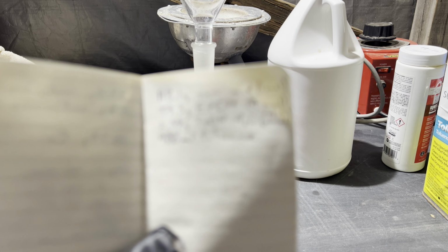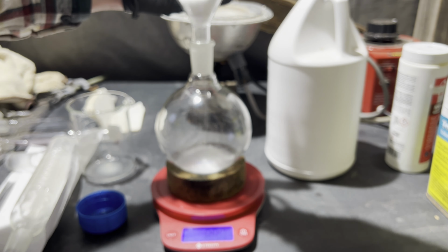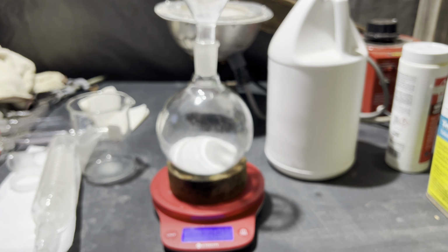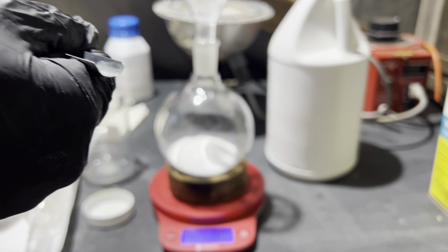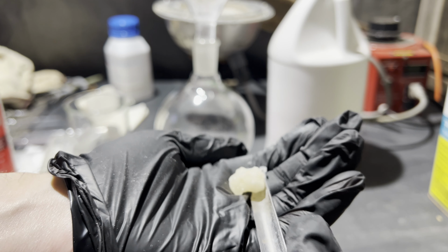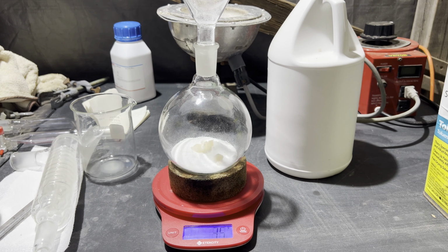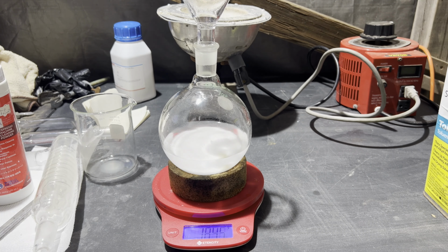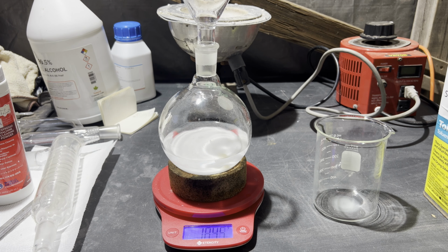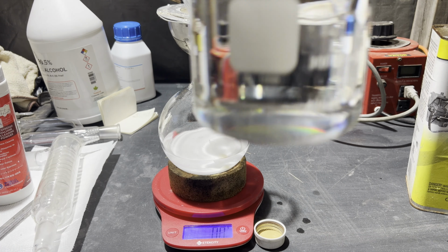All the reagents used were bought and used as is, other than the tosylic acid, which I made myself. A 100% excess of ethanol is used because, as I mentioned earlier, this reaction is full of equilibria, and an excess of ethanol will further favor formation of the diester. The tosylic acid I made is the monohydrate, and the water complexed with it will be removed during the reaction, just like the water produced from the esterification. It's a bit clumpy because it's damp with a little toluene, so I used 3.5 grams to be safe. It probably didn't make a difference since it's catalytic in effect, but oh well. A precise 400 milliliters of toluene isn't necessary, so I measured it approximately with a beaker.